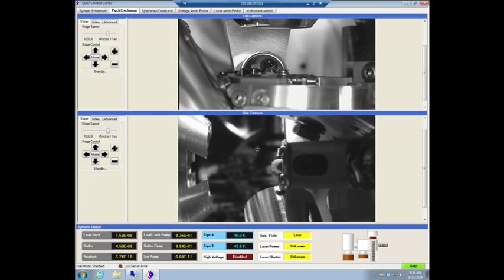The Puck Exchange tab, you've got the cameras, and there you can see Stefan is moving the samples. So the vertical transfer rod just went out, and then you can see the. So this is. You see it? Yeah.